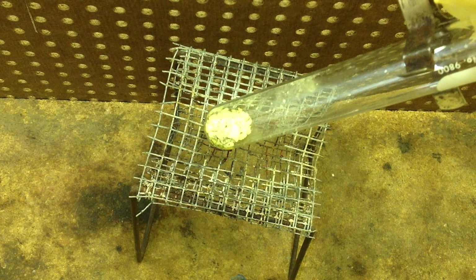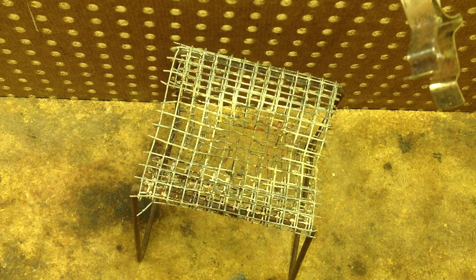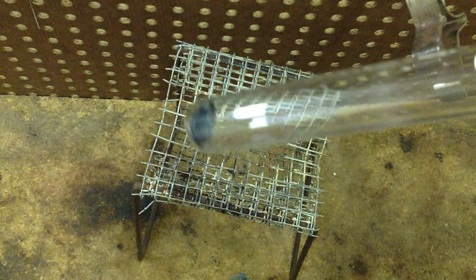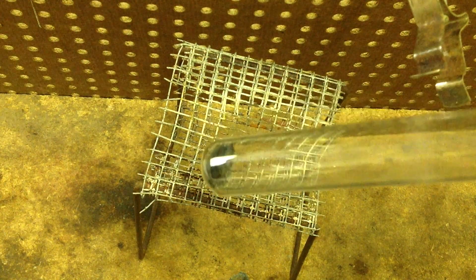I'm going to show you what that test tube will look like when it is heated and that red glow occurs. And this is what it's going to look like. There is going to be a black rock inside of that sealed test tube, still sealed. So something has definitely changed in there. We now have a black rock where before we had just copper and sulfur.